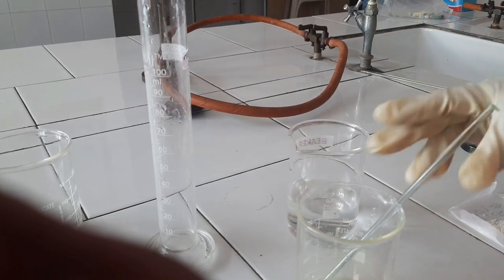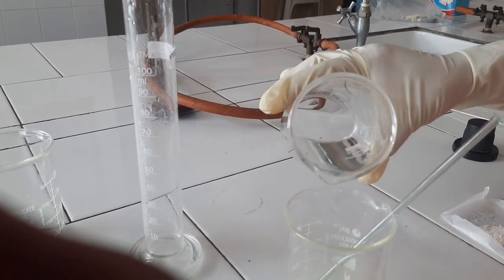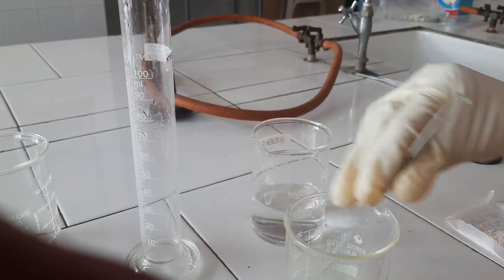Then add purified water in small portions with constant stirring.